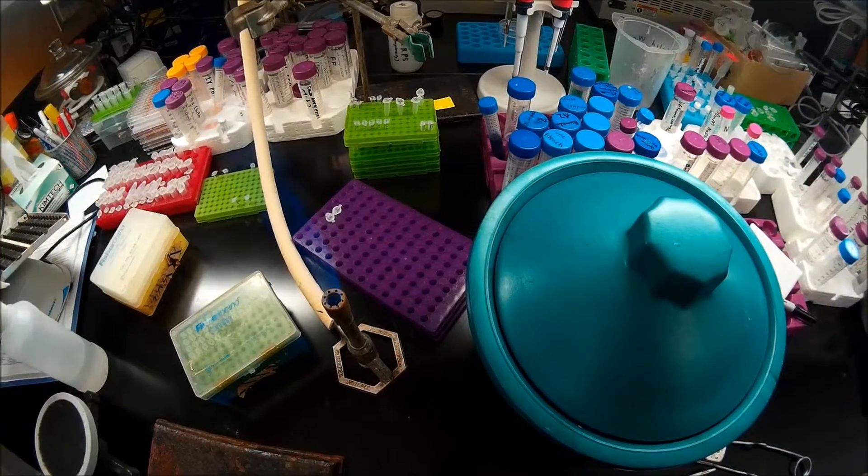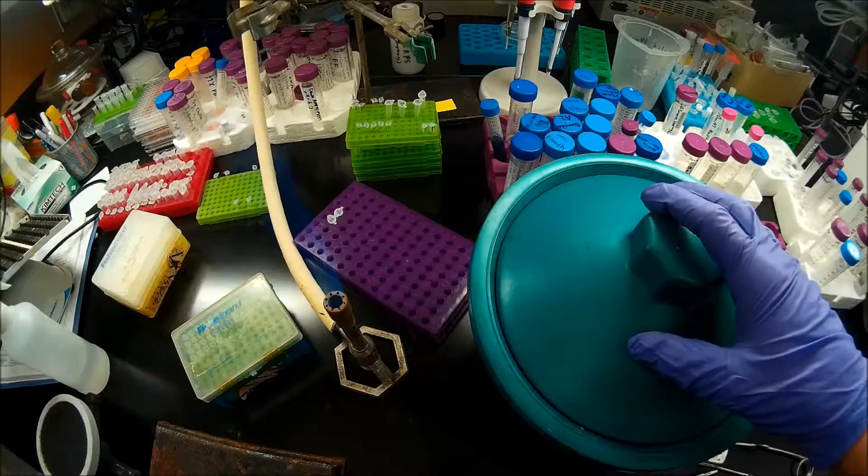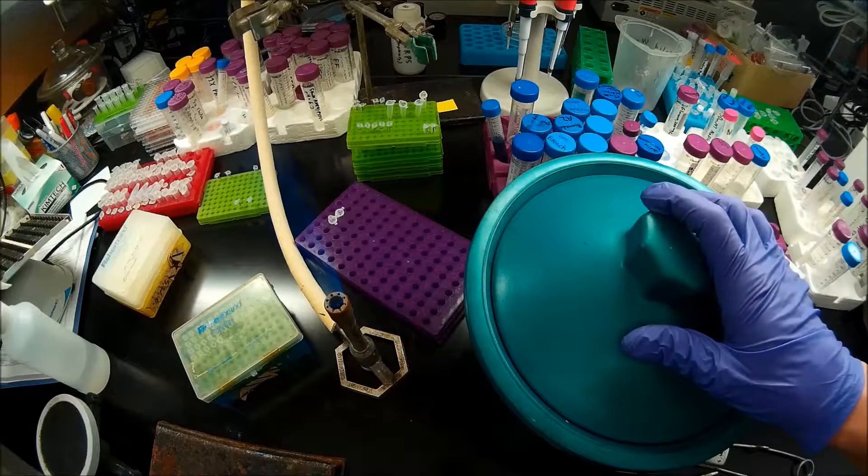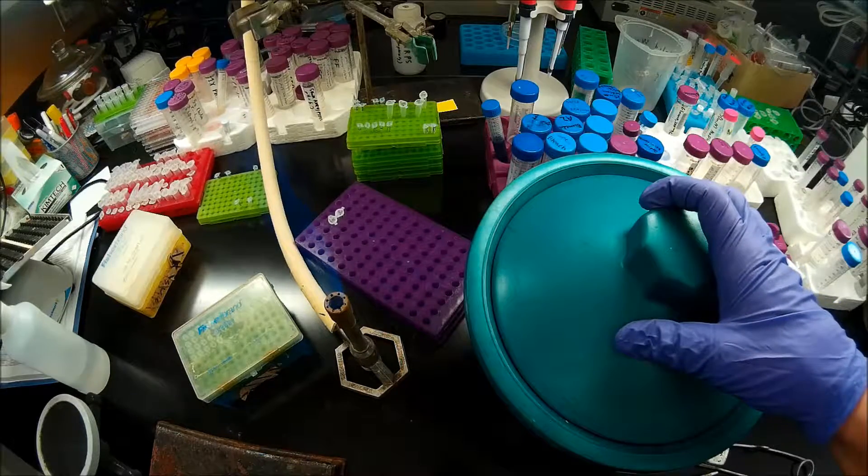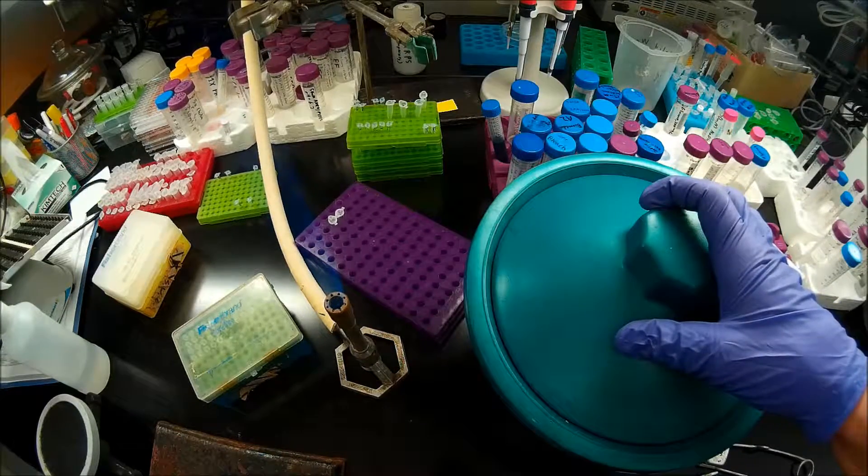As I was saying, these Z-Comp cells, these 100 microliter aliquots have a transformation efficiency of about 10 to the 6th colony forming units per microgram.